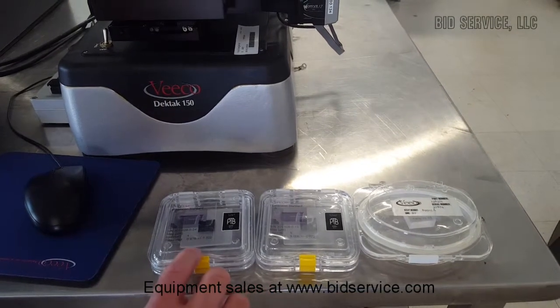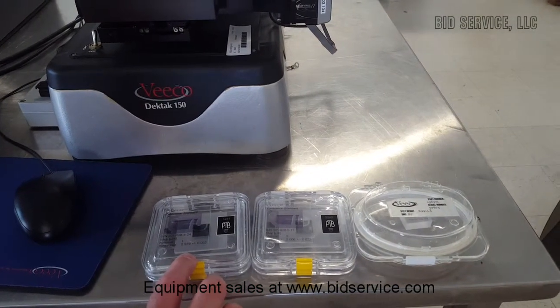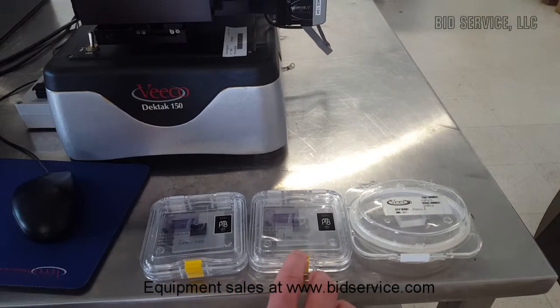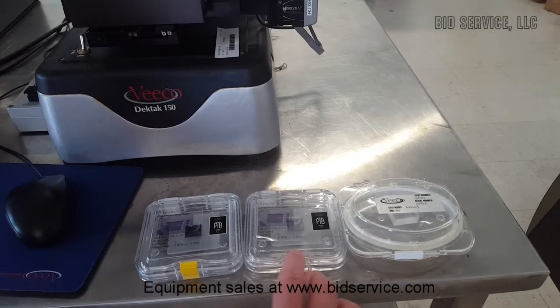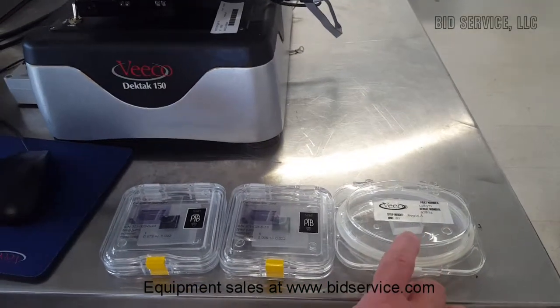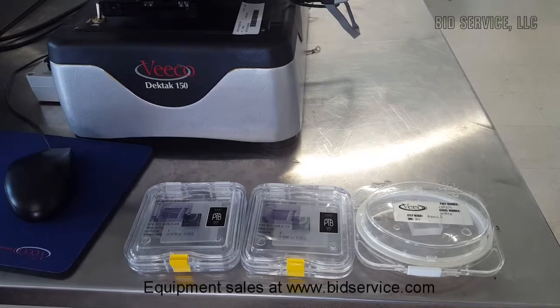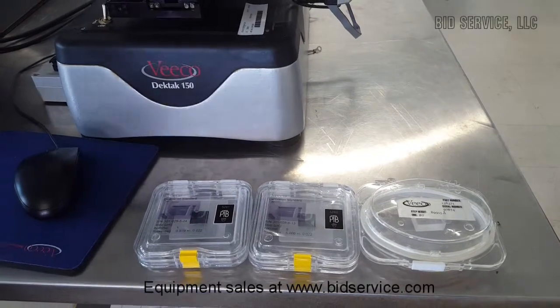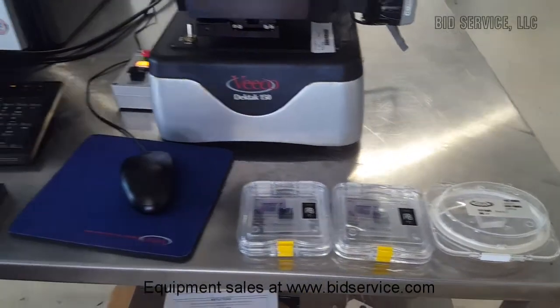This is a 1 micron standard to calibrate the lower range, a 5 micron for the middle range, and a 10 micron for the next range — the 524 range.